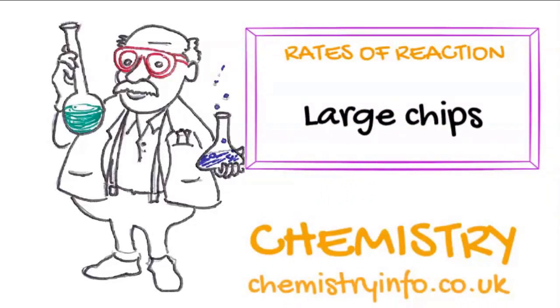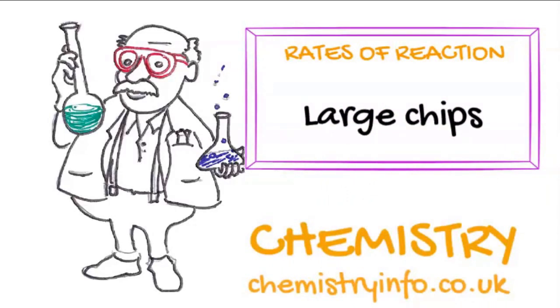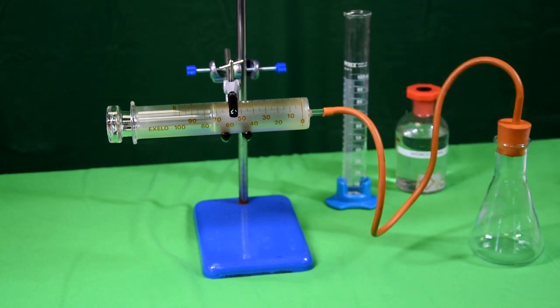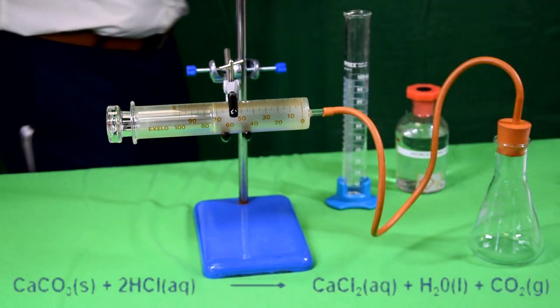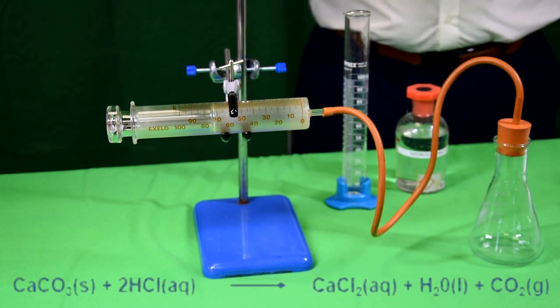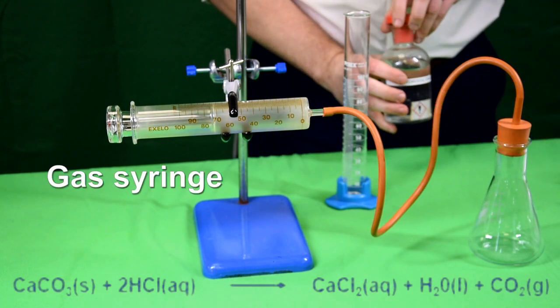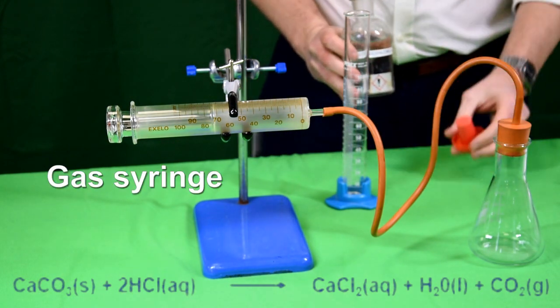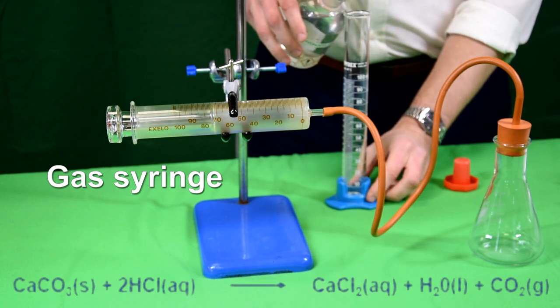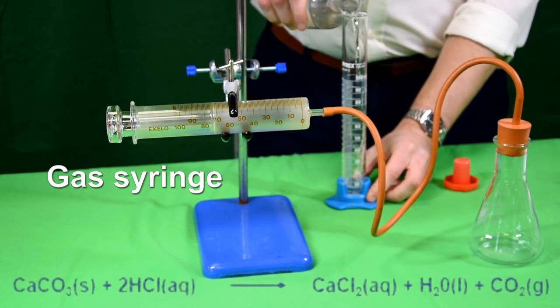Starting with large chips. Marble chips are calcium carbonate, so the reaction we're looking at is calcium carbonate plus hydrochloric acid, giving calcium chloride, water, and CO₂.